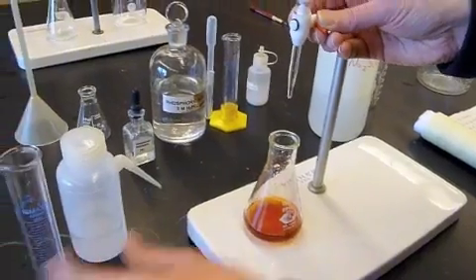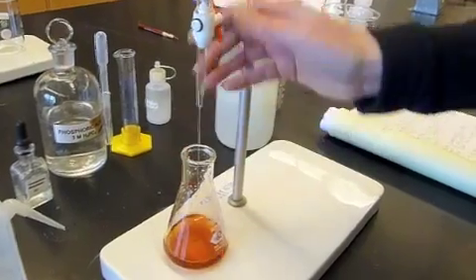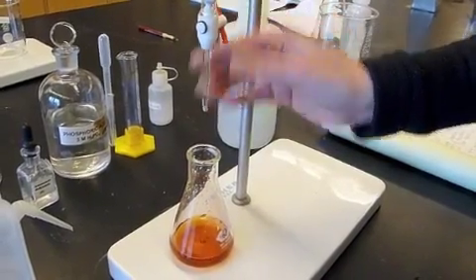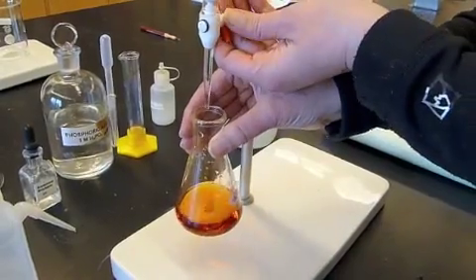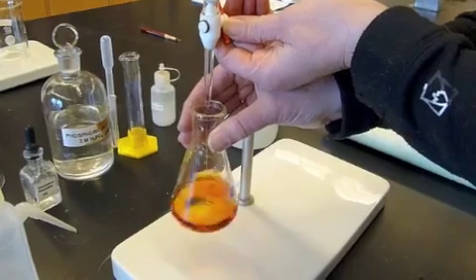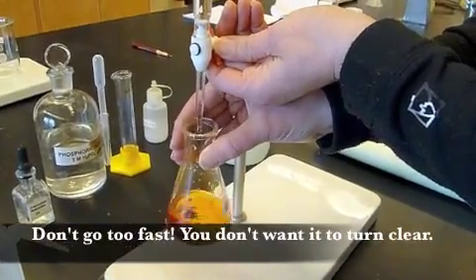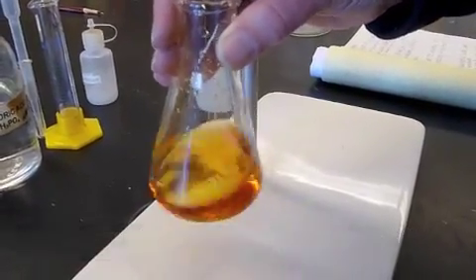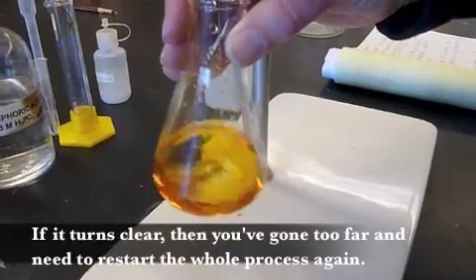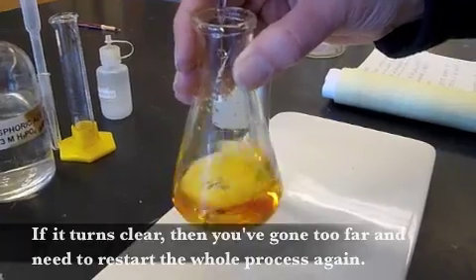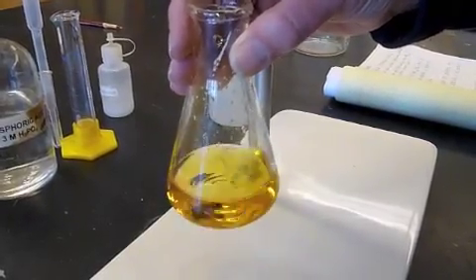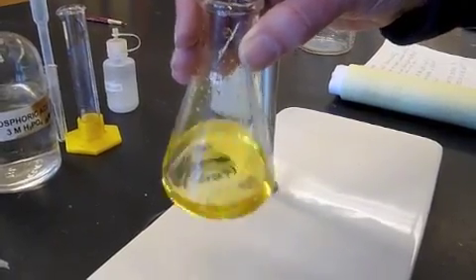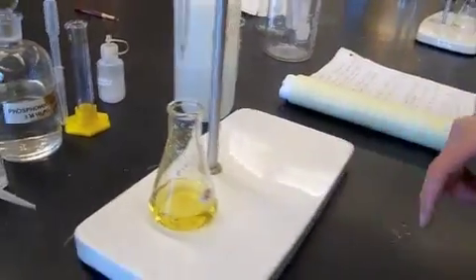What I'm looking for, slow it down a little. So we're looking for it to turn, you can have it drops or you can have it streaming, we want it to turn a light yellow. What light yellow means to some people, it might not mean to others. So that is our light yellow color.